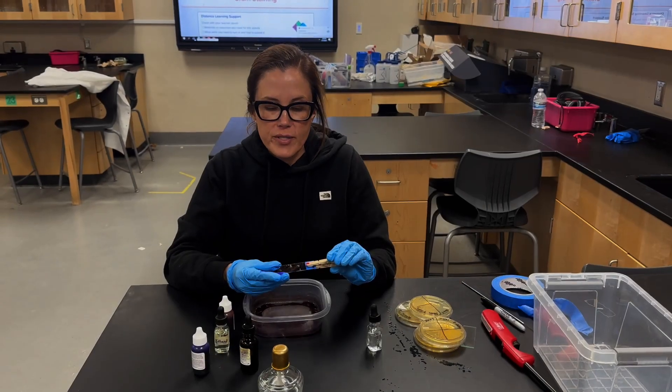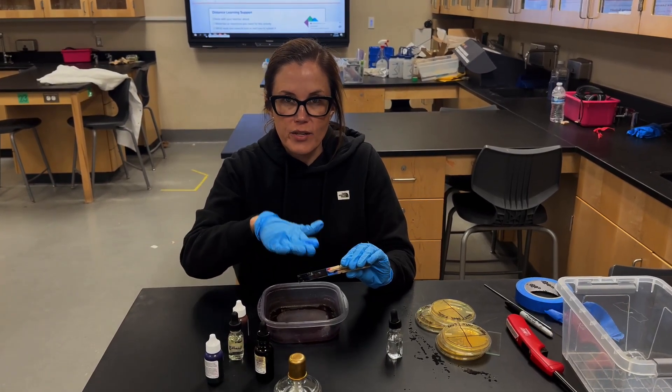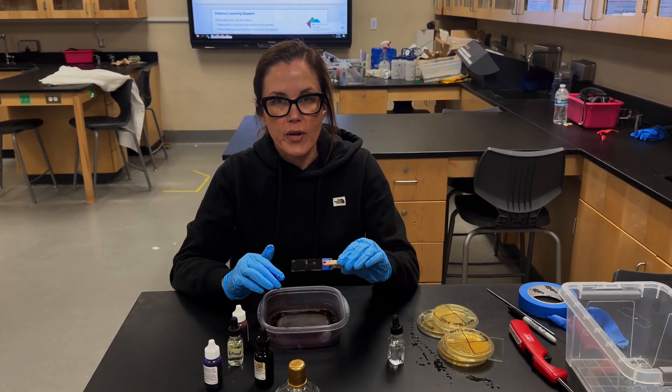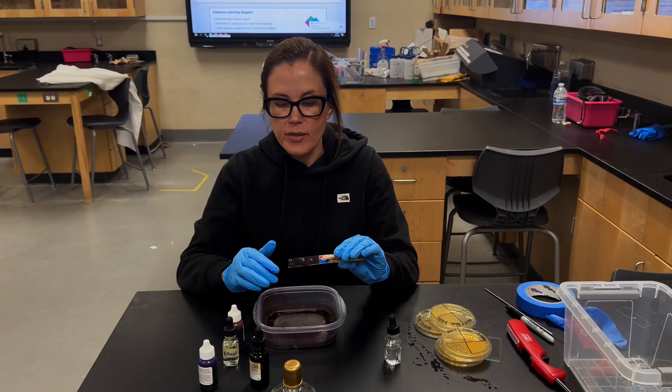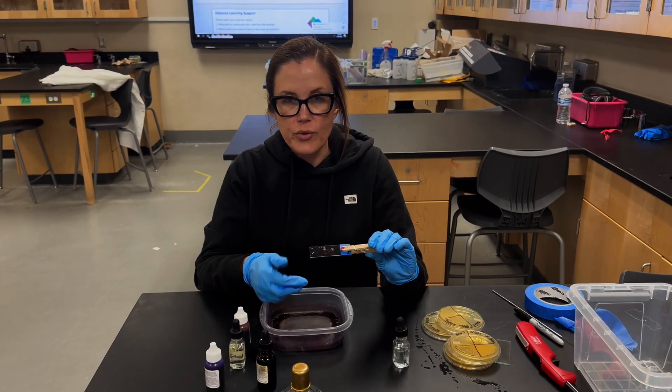If you're ready to view your sample at this point, you would just pat the sample dry, just carefully, gently pat it dry and you can view it under the microscope, and look for the morphology of the cells and the gram results at that point.